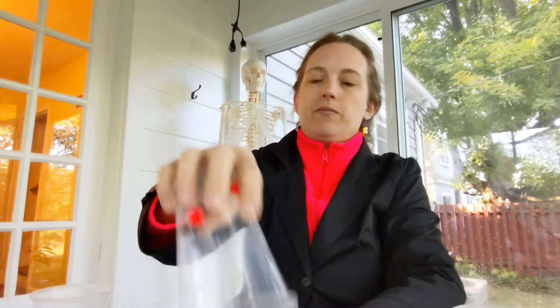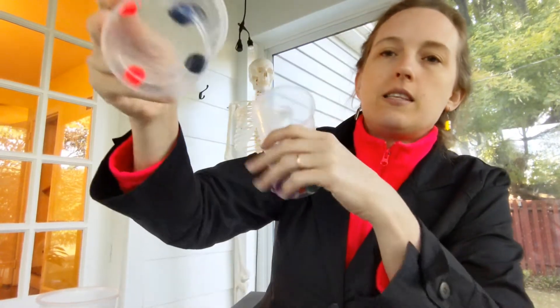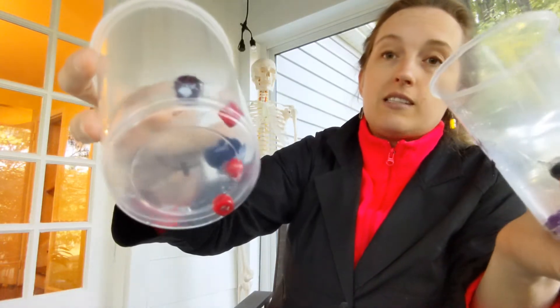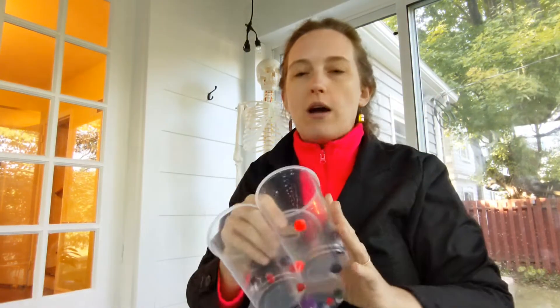We remove the excess and rinse with a buffer solution to see what's left. The plastic wells in an ELISA test are treated to allow proteins to stick to them. So in each sample, there are some proteins stuck to the well. But we have millions of proteins inside us — are these the right proteins? Are they the antigens to meningococcus — the target antigens? We don't know yet. And to the naked eye, we can't see anything at this point, which is why we still have more steps to do.